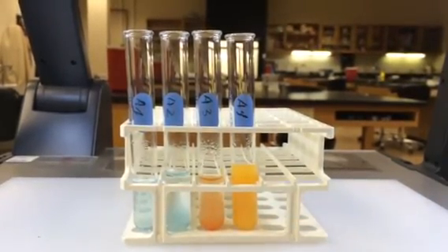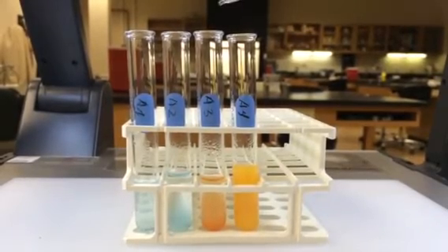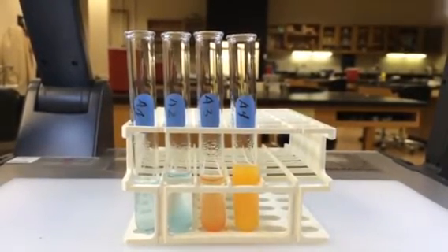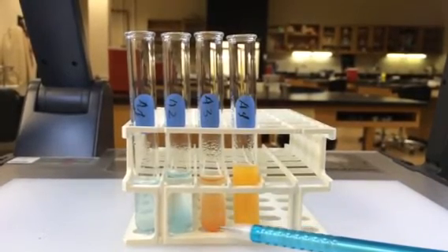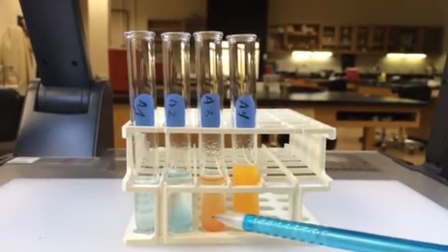Tube A3 contains maltose, water, and Benedict's reagent. This shows the color of a positive Benedict's test — that orange color.